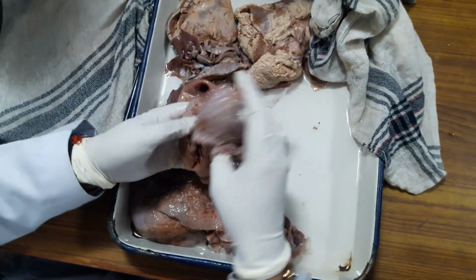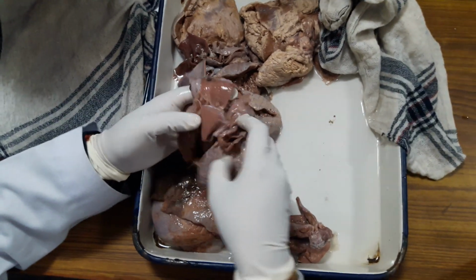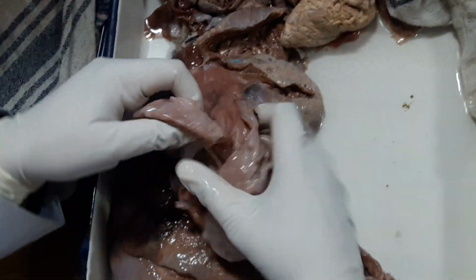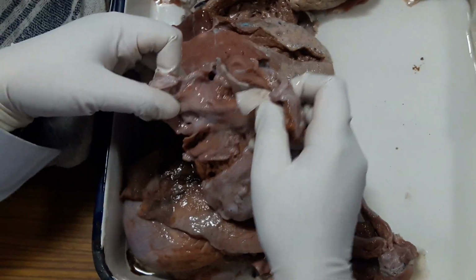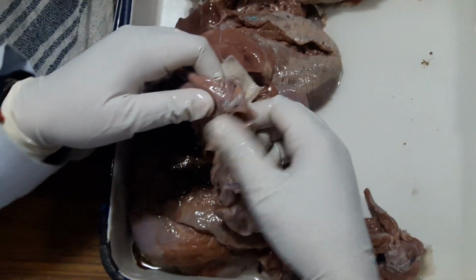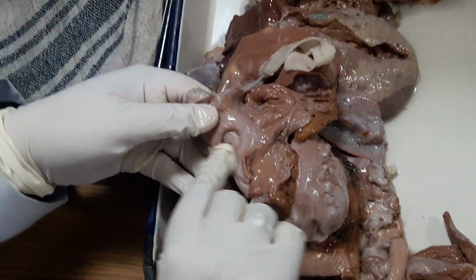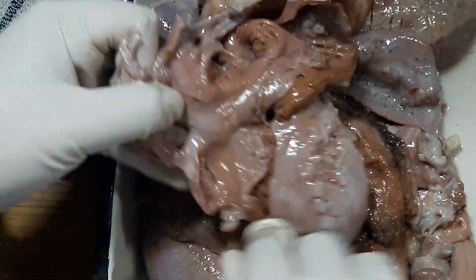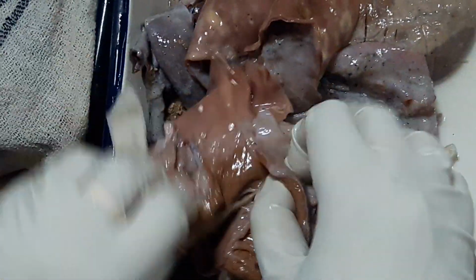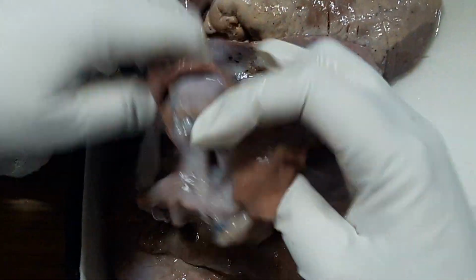It will be a newborn heart; it is not written fetal heart, it is a fetal heart. Again hold it in anatomical position. It will be a newborn heart. See the right side. Neonatal. This is the fossa ovalis, which is the site of ostium secundum type of ASD. Okay, this is the limbus. Okay, now this is the right ventricle. Pulmonary artery is normal.